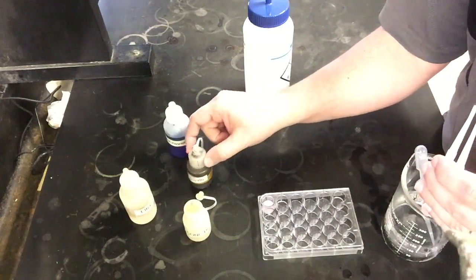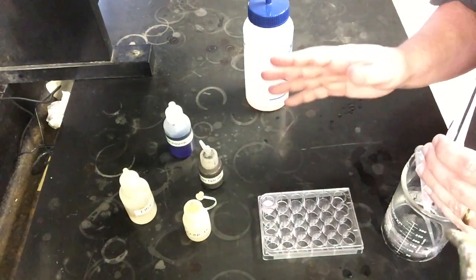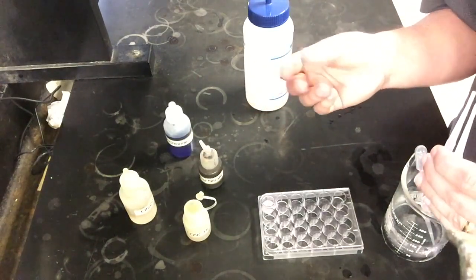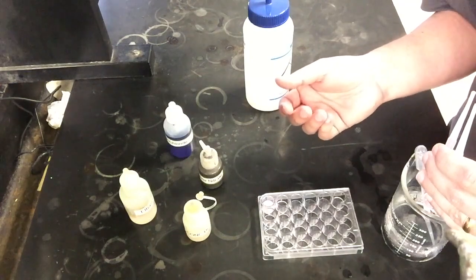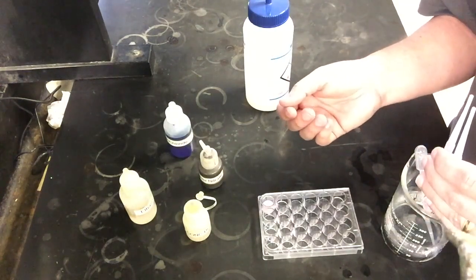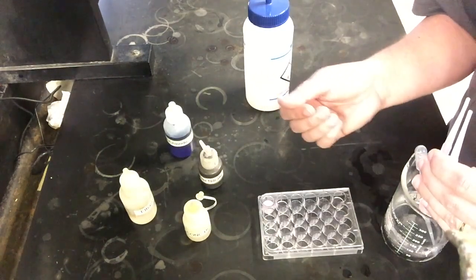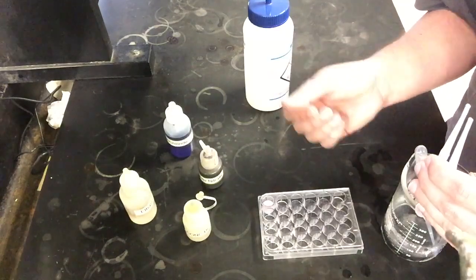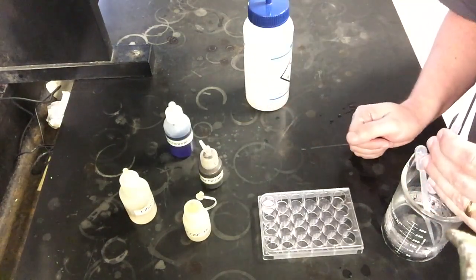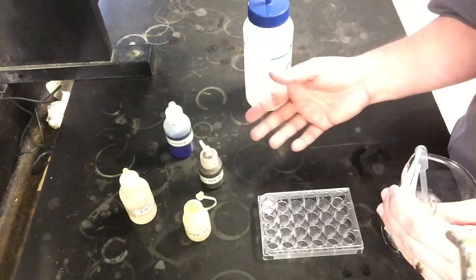I will make a special note on silver nitrate, just for those of you that have never used it before. If you get it on your skin, you probably won't notice it right away. It doesn't hurt or anything like that. It's not usually a big irritant unless you get a lot of it on your skin. Usually what will happen is after a day, it will probably turn your skin black. The silver can actually react with light in particular. So once you've been exposed to sunlight or just enough regular light, that silver can react and you actually get kind of black splotches on your skin wherever you spilled the silver nitrate solution. So something to be aware of and careful of.